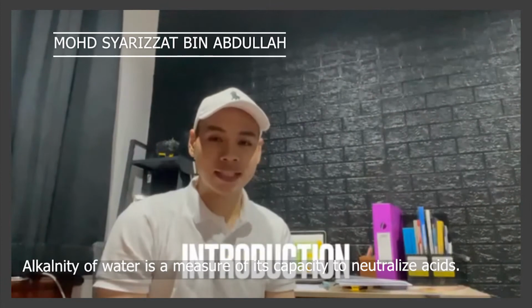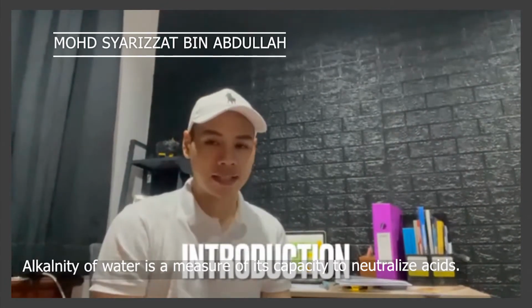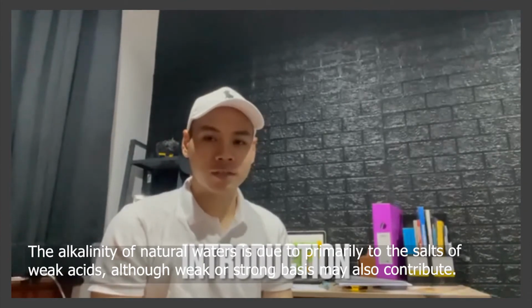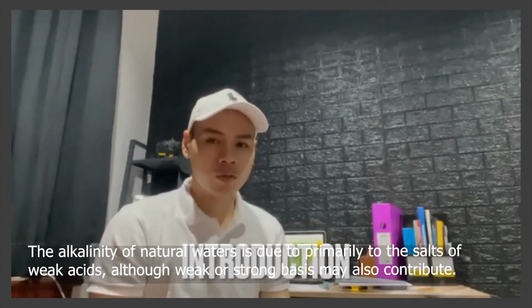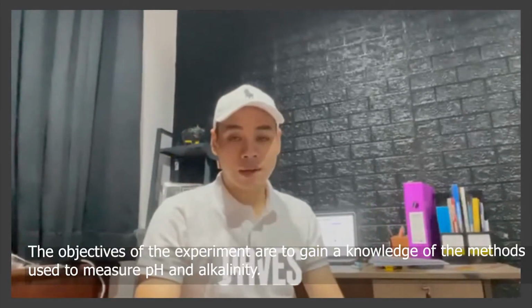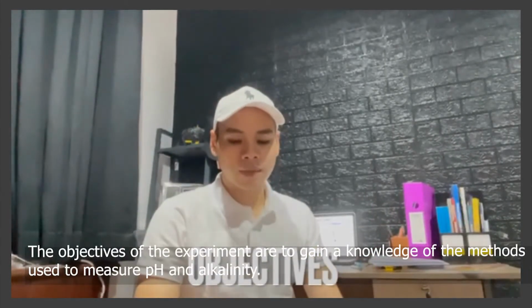Alkalinity of water is a measure of its capacity to neutralize acids. The alkalinity of natural water is due to the salts of weak acids, although weak or strong bases may also contribute. The objective of this experiment is to gain knowledge of the method used to measure pH and alkalinity.